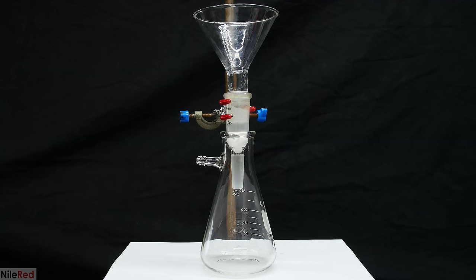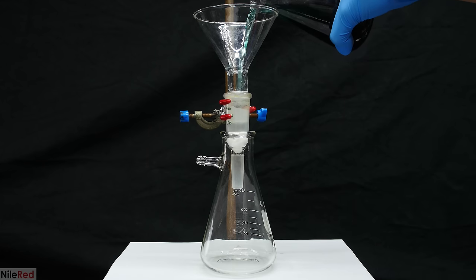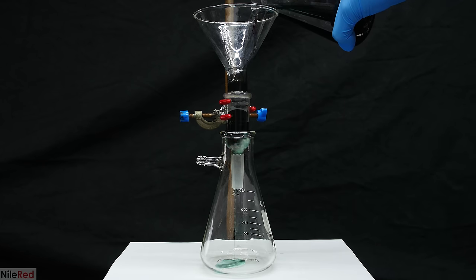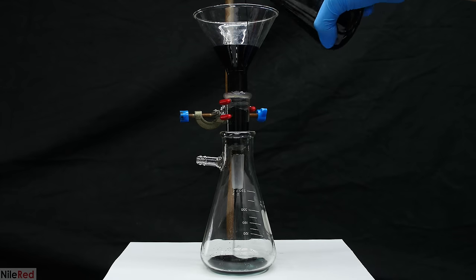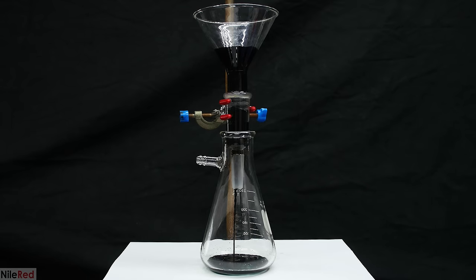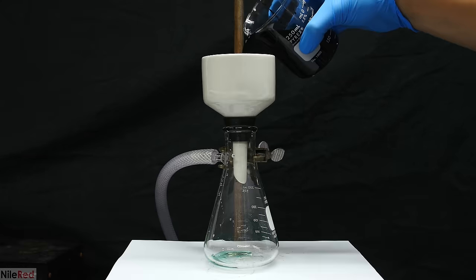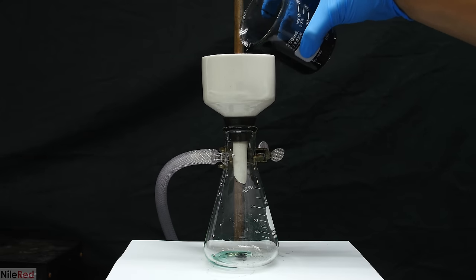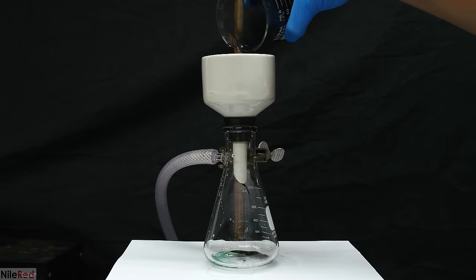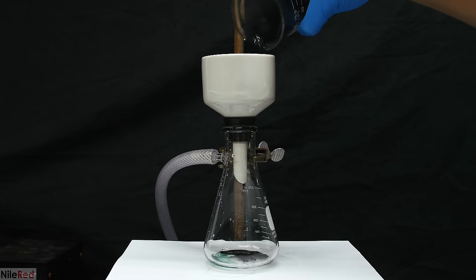What we need to do next is separate the black nickel boride solid from the reaction solution. This can be a pretty big pain because the nickel boride that formed is extremely finely dispersed. I tried to do a gravity filtration here through some cotton, and it clearly fails. The best way that I found to separate it was by vacuum filtration, where I pulled it through, I think, two or three filter papers.